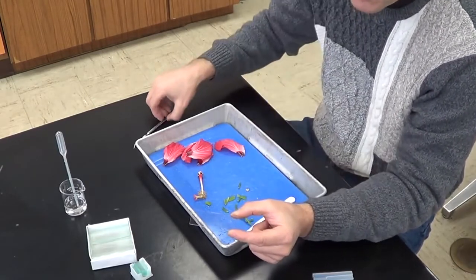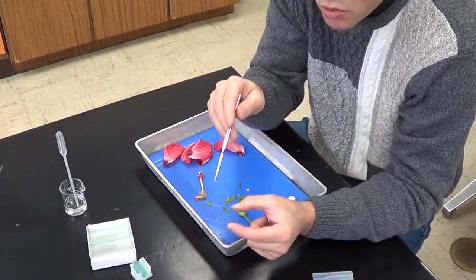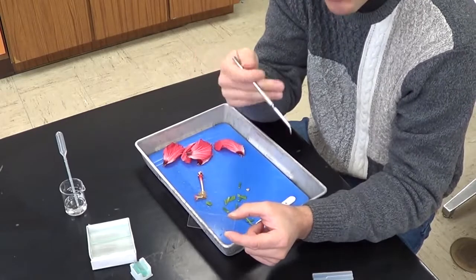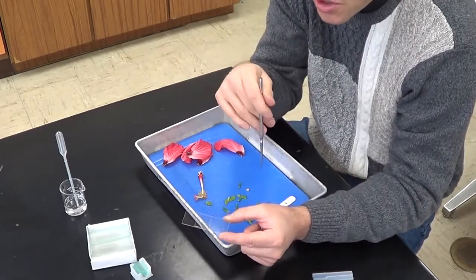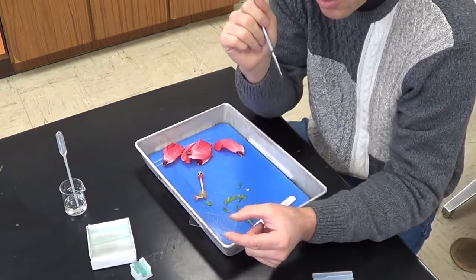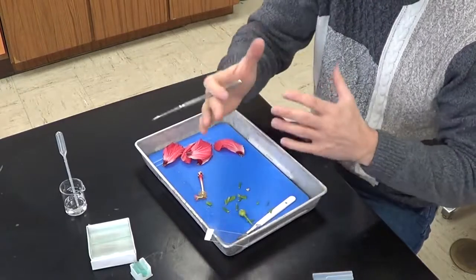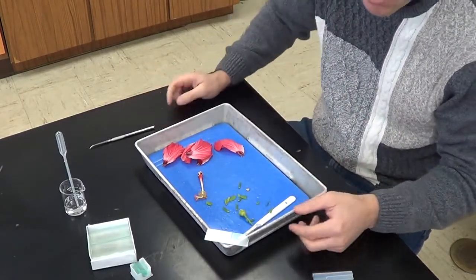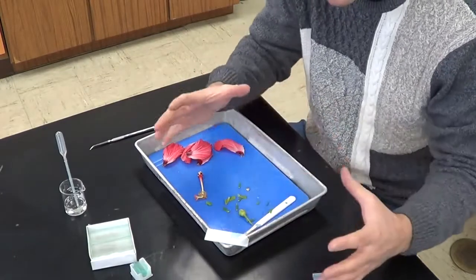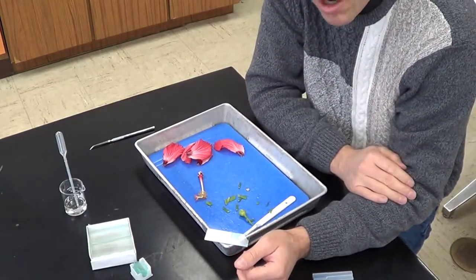What you want to look for, at least in this particular case, is some round structures with little spikes coming off of them. And those are our pollen grains. And again, pollen grains come in different sizes and shapes, but typically they're kind of round, sort of uniform in size. If you see a lot of round structures that are different sizes, chances are you're looking at air bubbles. If you see structures that are fairly uniform in size, most likely going to be your pollen grain.